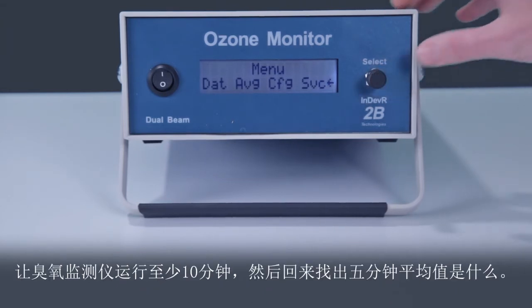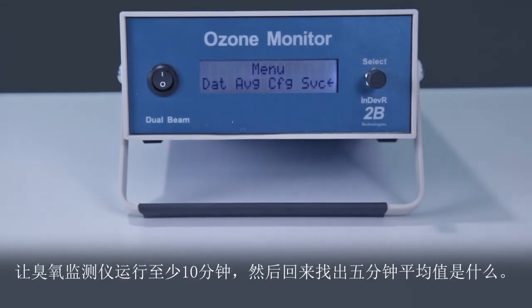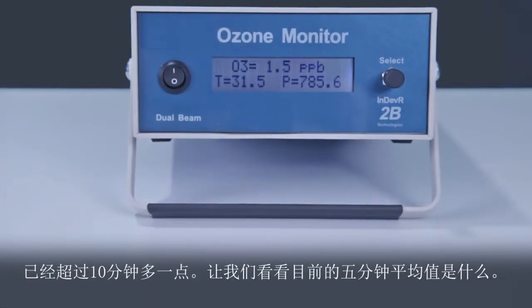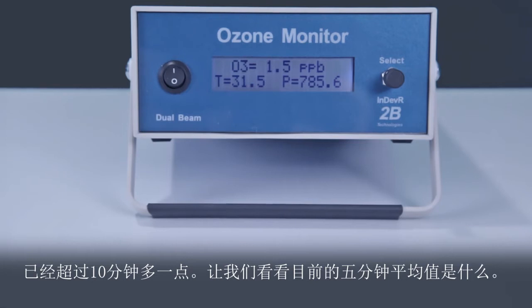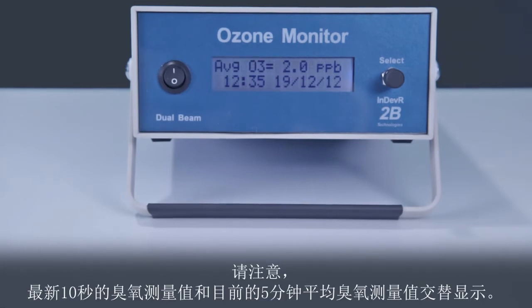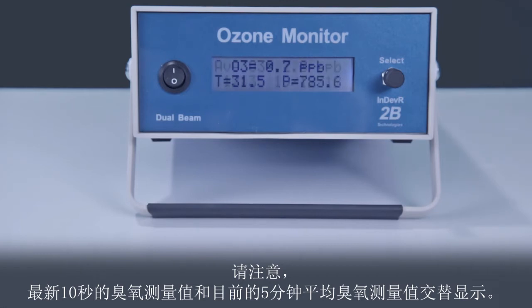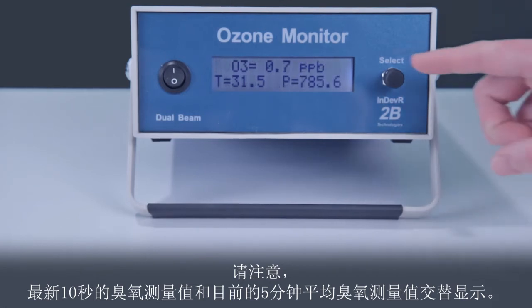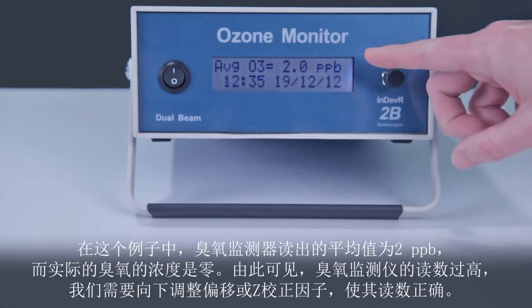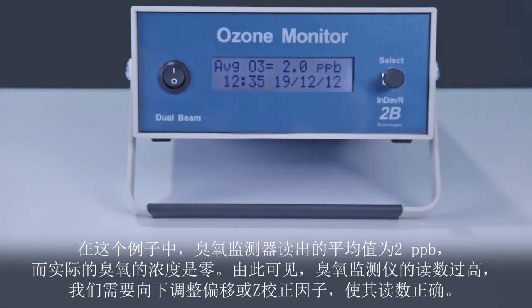Let the ozone monitor run for at least 10 minutes and come back to find out what the 5-minute average value is. It's been a little more than 10 minutes now. Notice that the display alternates between displaying the most recent 10-second ozone measurement and the current 5-minute average of ozone measurements. In this example, the ozone monitor is reading an average value of 2 ppb when the actual ozone concentration is zero.